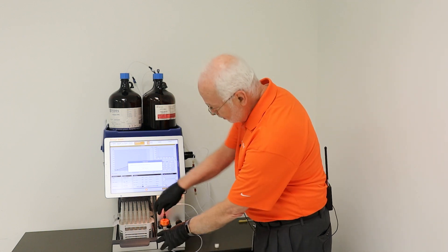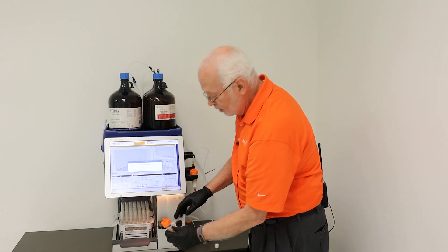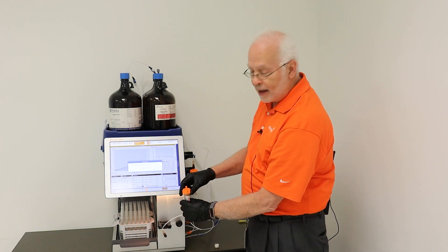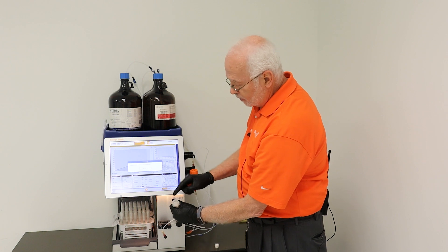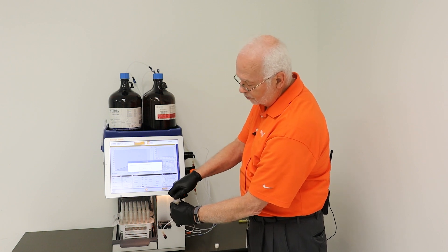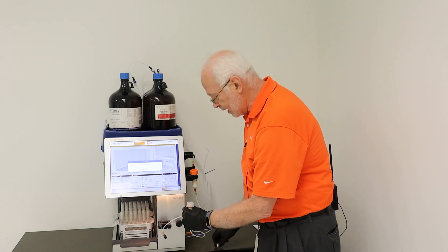The best way to do that: remove the connecting tubing from the top of the column, then remove the cap. Then there's a little piece in here that you would remove as well.